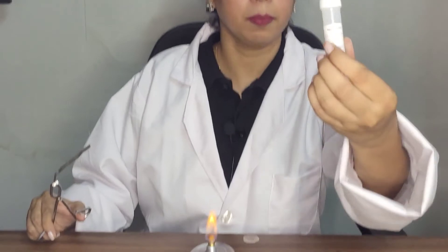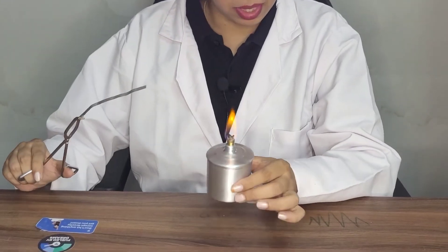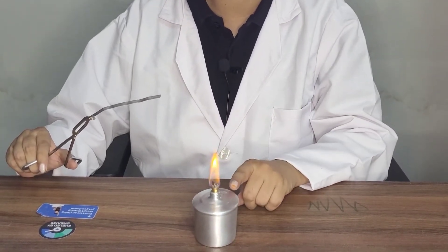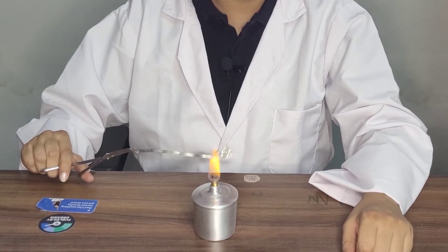So here you can see I have taken a magnesium ribbon. So here there was magnesium ribbon. Now I will burn the magnesium ribbon in presence of oxygen. So here I have taken a spirit lamp and I am burning the magnesium ribbon.